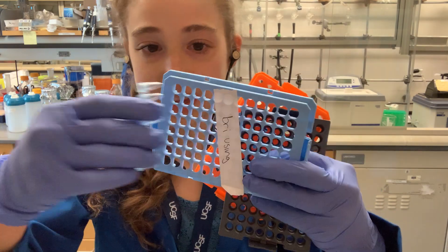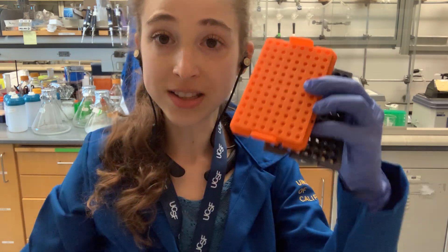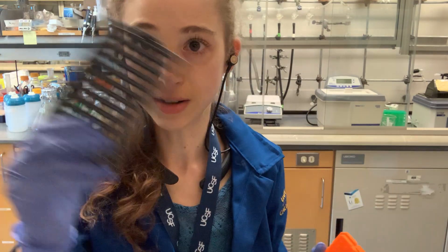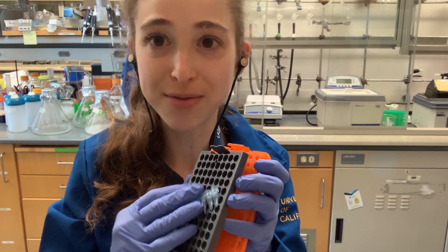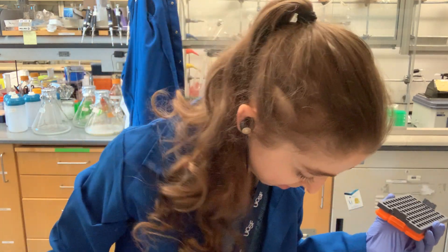If you have the bigger ones they're going to be too big, and the smaller ones will be too small. But don't worry — you can stick the smaller ones on the bottom of the size you want. Even if you haven't gone through two of the good-size ones, you can put the right-size one on top and the off-size one on the bottom.